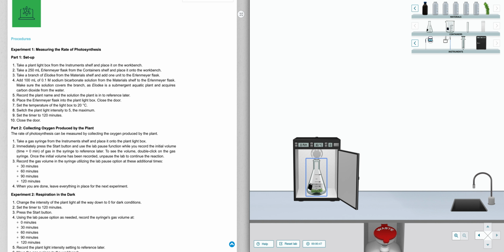And then see here where it says close the door. Well, you can't close the door. First, you have to do steps 7, 8, and 9, and then close the door. So to do this, to change these numbers, you have to click this button on the right-hand side. So click that, and it makes it where you can change the values.